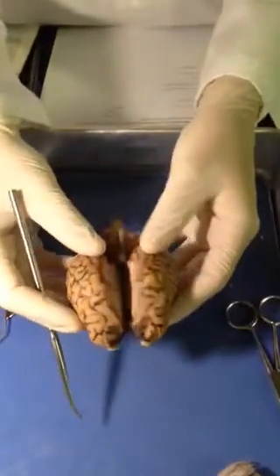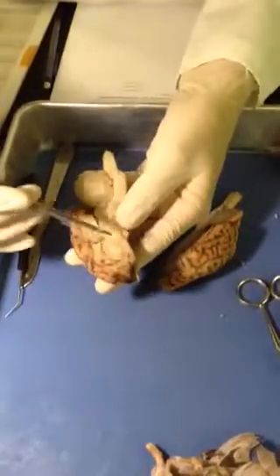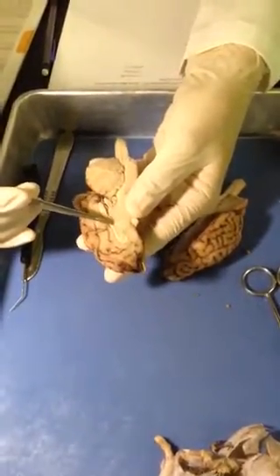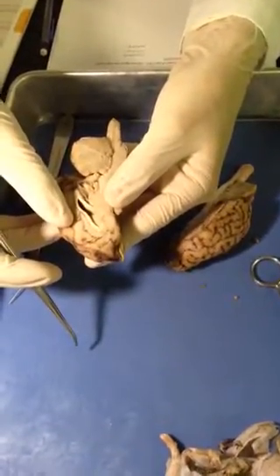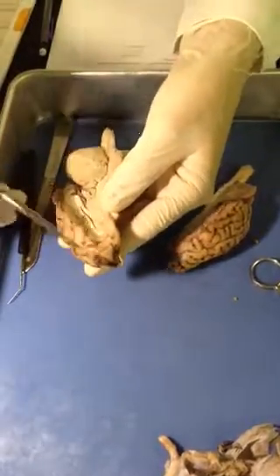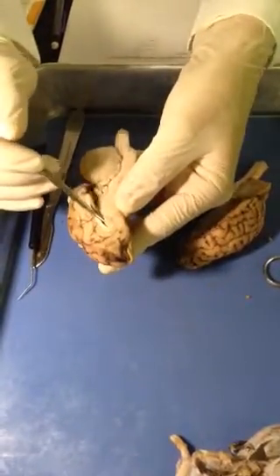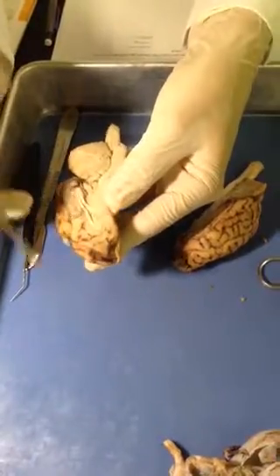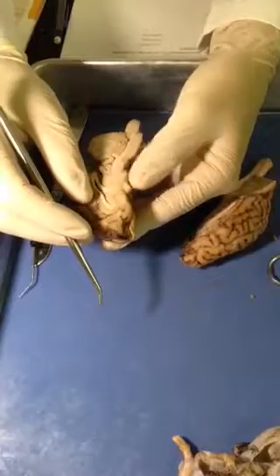Here we have the sheep's brain after the mid-sagittal cut. On the inside, you can see this top white part here is the corpus callosum, and that's at the top of the one side of the lateral ventricle, which were separated during the cut, and on the bottom we have the fornix. You can kind of see a little bit here, this membranous material that would have been the septum pellucidum, which separates the lateral ventricles.